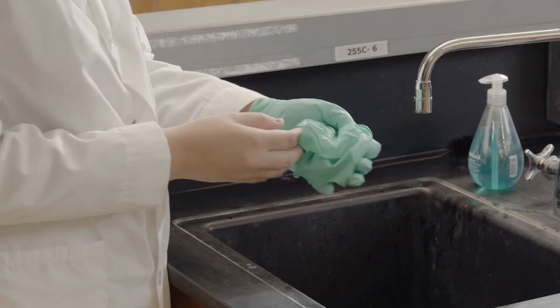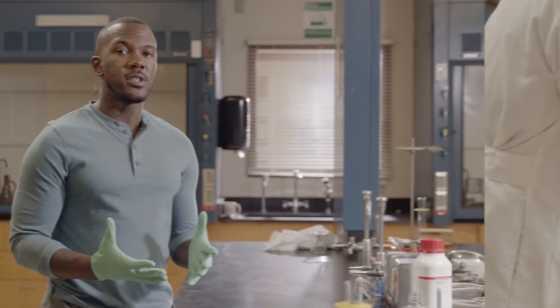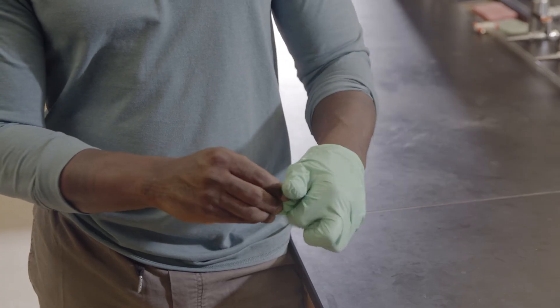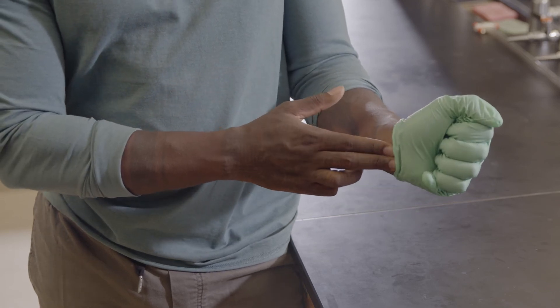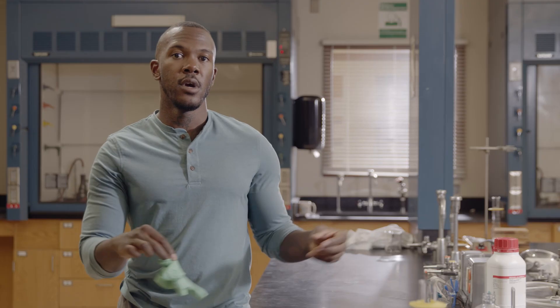Always remove your gloves before leaving lab and wash your hands at the end of class. To minimize exposure, it's important to remove gloves correctly so chemicals don't contact your skin. To start, pinch the first glove near the wrist and start peeling it off while turning it inside out. Crumple the removed glove in the palm of the gloved hand. Then use your ungloved hand to peel off the second glove and enclose the crumpled one. Discard these used gloves as directed by your instructor.